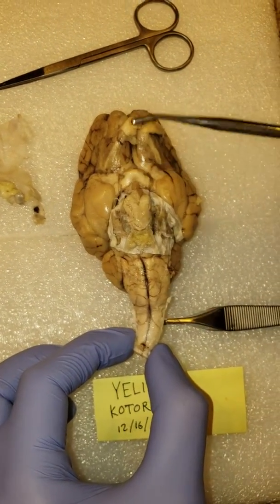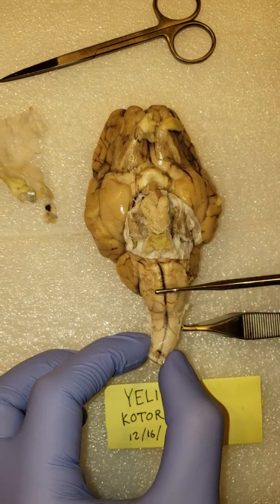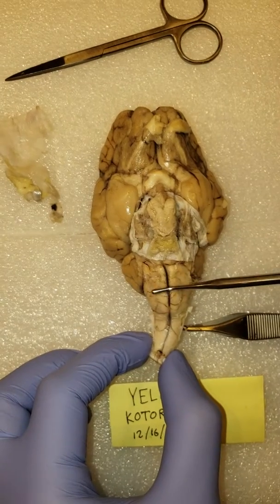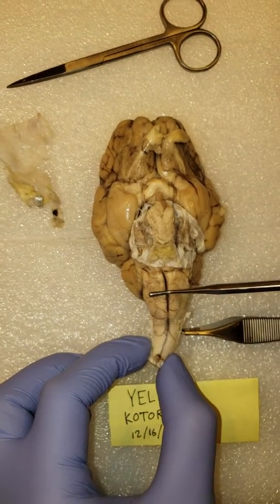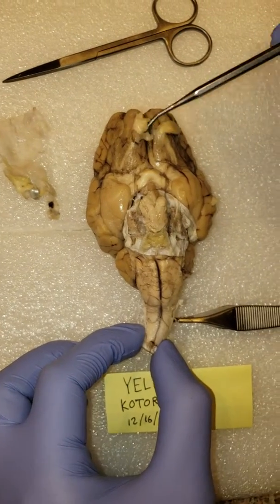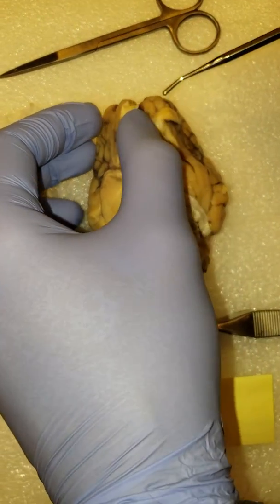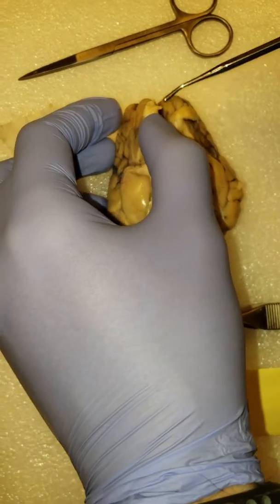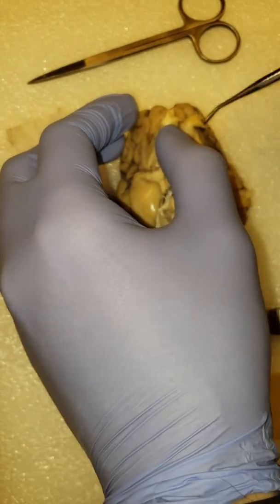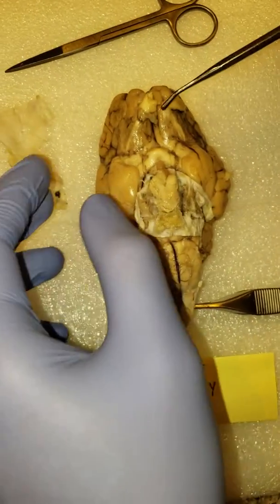And so we've got the brainstem. We've also got the medulla. This little bump is the medulla. Above that is the part of the brain called the pons. And if we go further up, at the very, very top, we've got these two small little guys called the olfactory bulbs, responsible for receiving and transmitting to the brain information about smells and stuff like that.